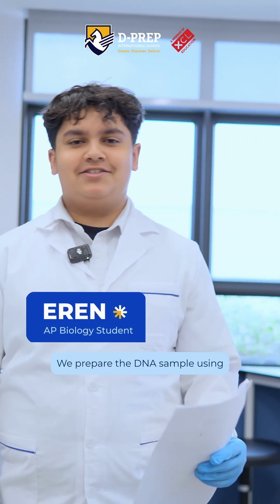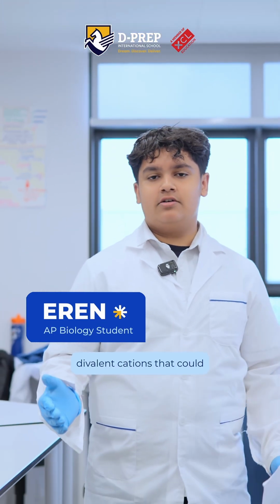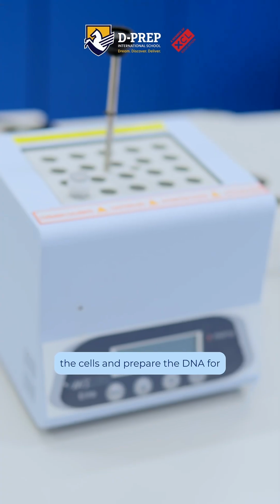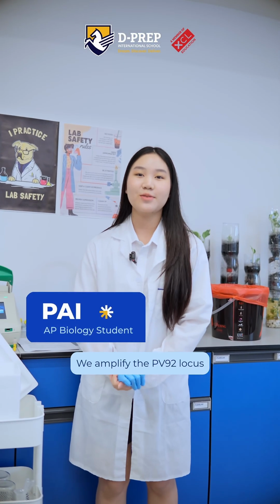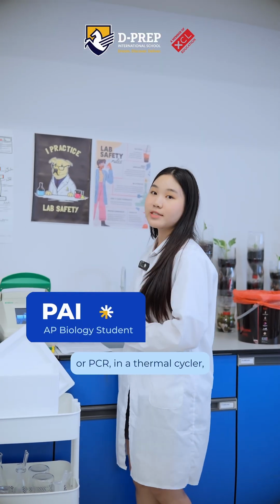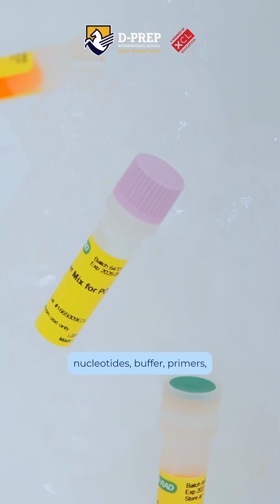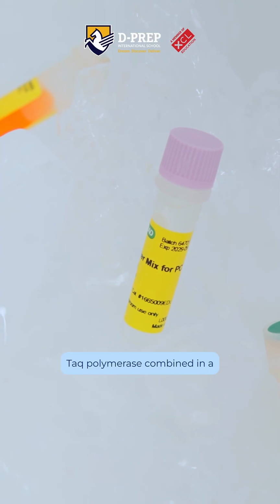We prepare the DNA sample using Chelex matrix, which binds divalent cations that could otherwise degrade the sample during heating. We then incubate the sample in a dry bath to lyse the cells and prepare the DNA for amplification. We amplify the PV92 locus using polymerase chain reaction, or PCR, in a thermocycler, which precisely controls when temperature changes. The reaction includes nucleotides, buffer, primers, and Taq polymerase combined in a master mix.